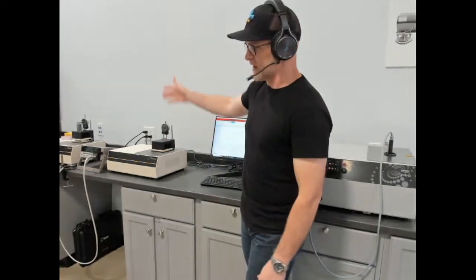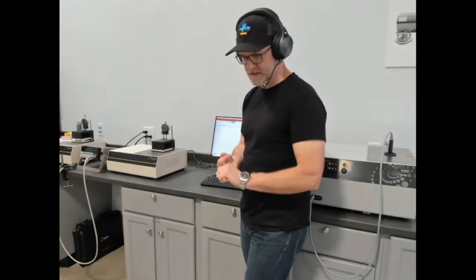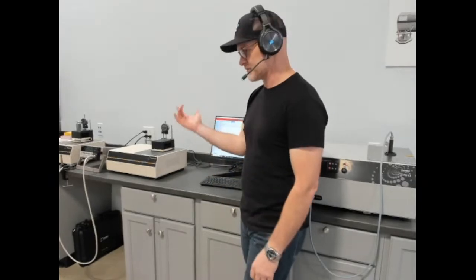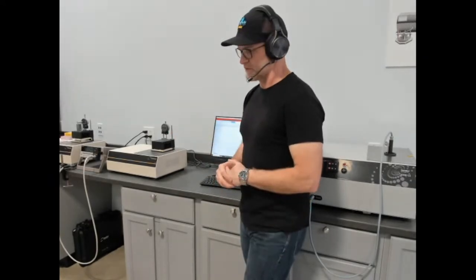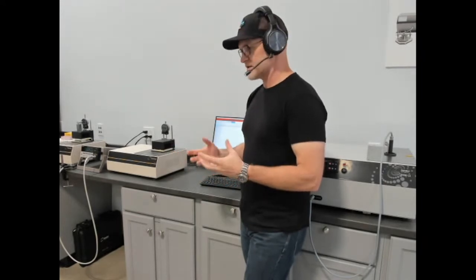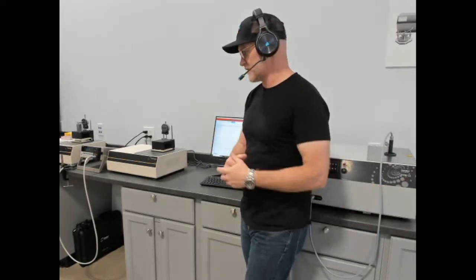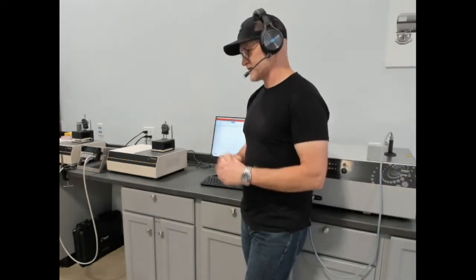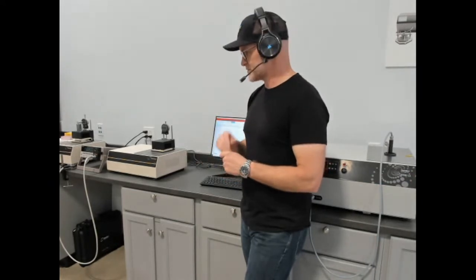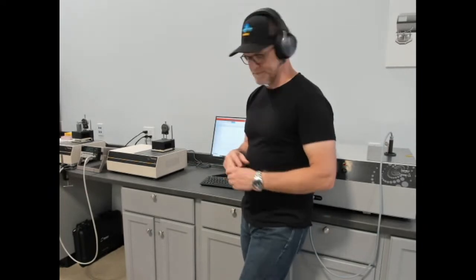Typically, to the left of that would be our MP2, our measurement platform for portable. So we have 3 MPs: MP1 for advanced, MP-V for mid-range, and our MP2 for portable. That is on its way back from a trade show, and we don't have it, but that is an intelligent portable platform combining almost the same methods that you see in our MP-V and MP1, just very small ranges for specific applications, but quite good performance and versatility.